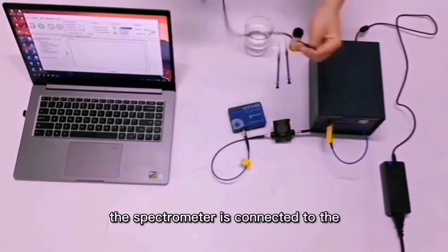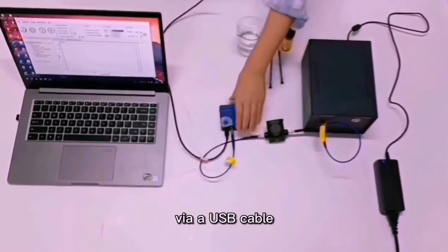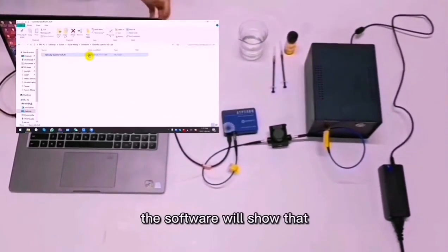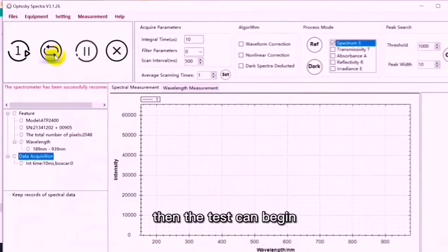The spectrometer is connected to the computer software via a USB cable. The software will show that the connection was successful. Then the test can begin.